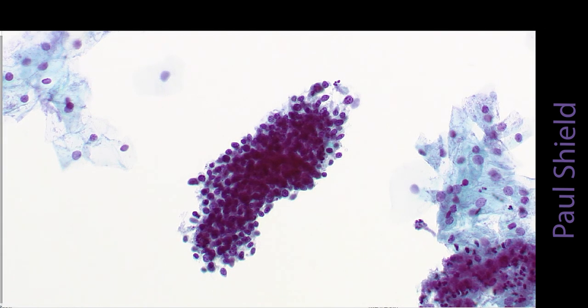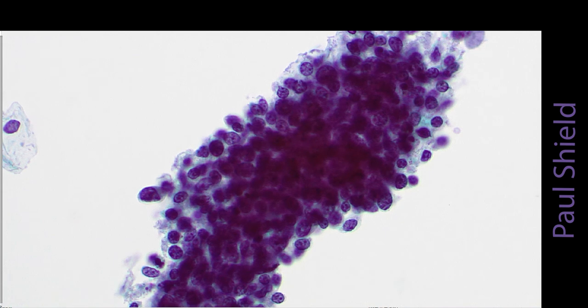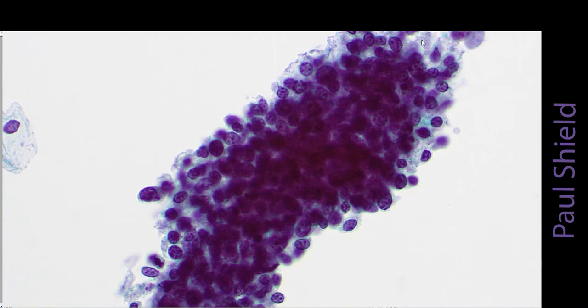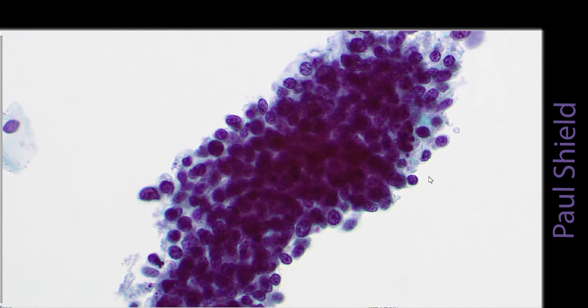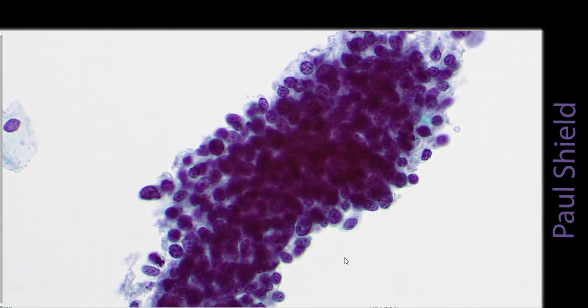Another area that's very tricky and a lot less common is follicular cervicitis, when you get artifactually clumped groups of lymphocytes. This is an example of that, and this looks really like a crowded hyperchromatic group with high NC ratio, so it's quite tricky. What you have to recognise here is the very small size, hard to compare here, I don't have an intermediate, and the very round shape to all of the nuclei, and quite a bit of variation maybe in size, but none of these will be terribly large, and the chromatin will not be terribly coarse, even though they're very hyperchromatic in this case.